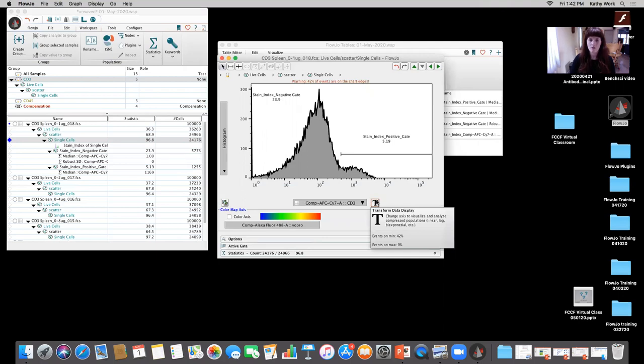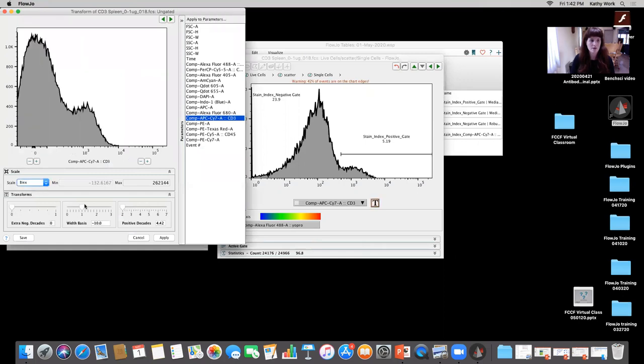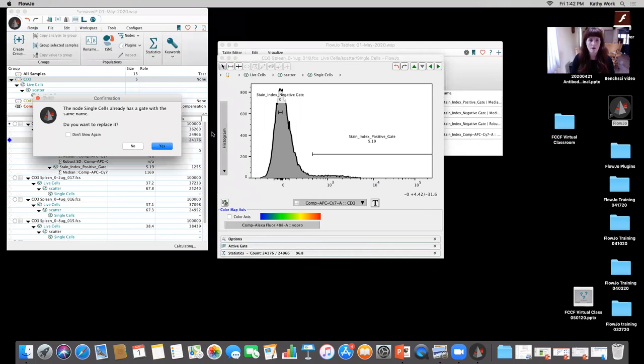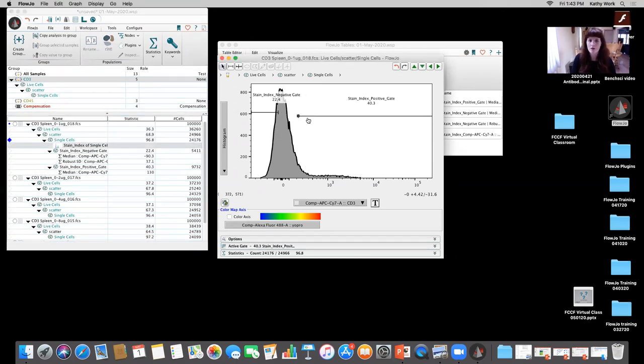So I'm going to go ahead, I'm going to hit this little transform button, customize the axis, change this to biex. I'm going to try and get a little bit of a better view on that negative. Now there's the chance if I had had that scaling a little bit better when I started that it automatically would have found a better identification of those populations. So you can go ahead and replace that. A little bit of a better job identifying those populations.